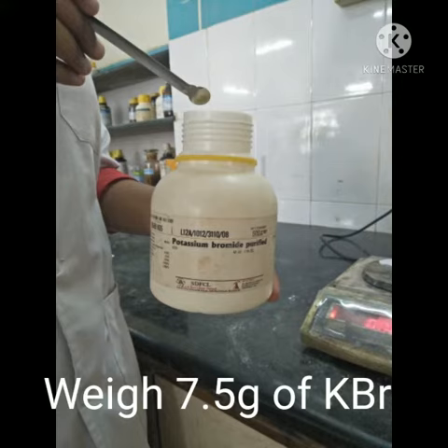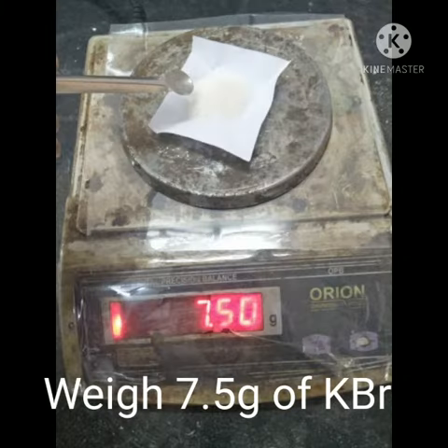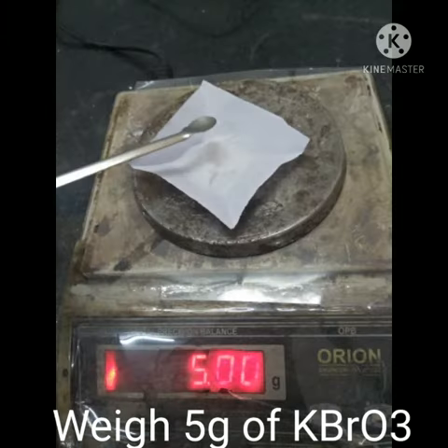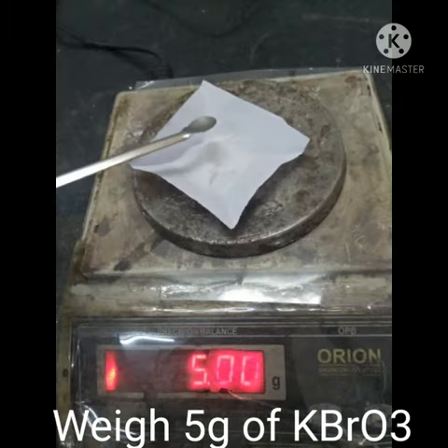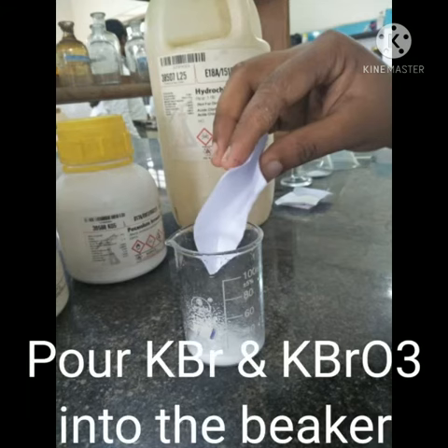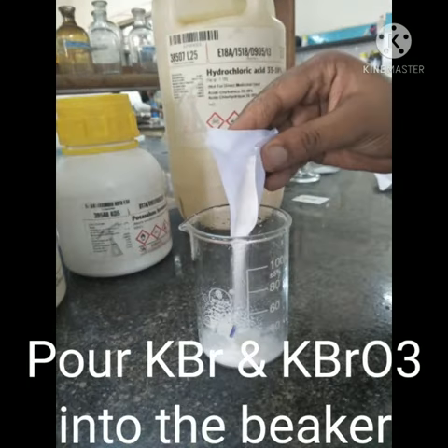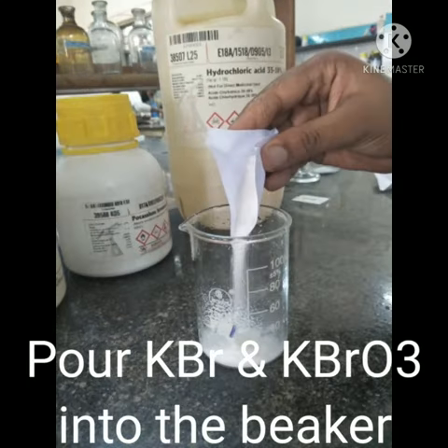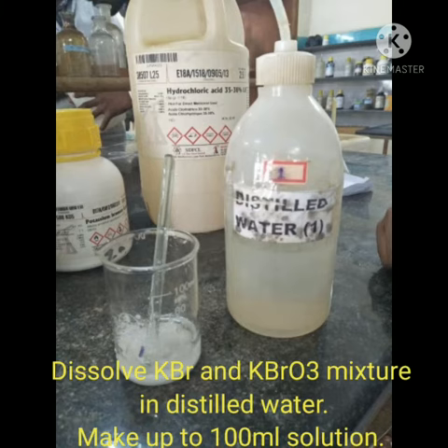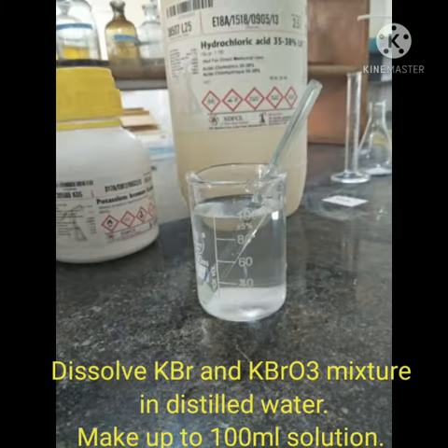Take 7.5 grams of KBr and 5 grams of KBrO3. Pour KBr and KBrO3 into the beaker. Dissolve the KBr-KBrO3 mixture in distilled water and make up to 100 ml.